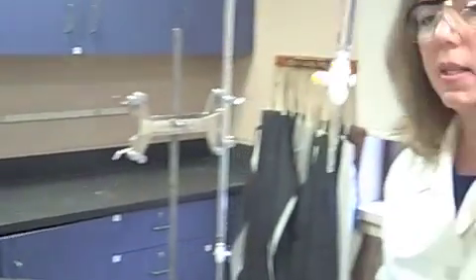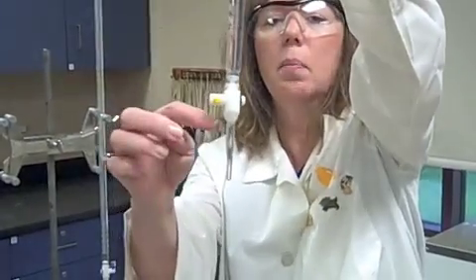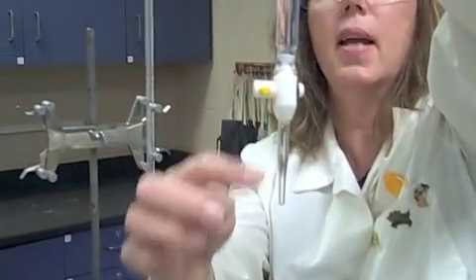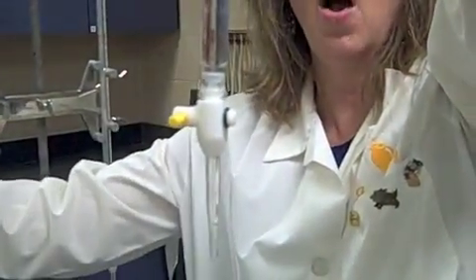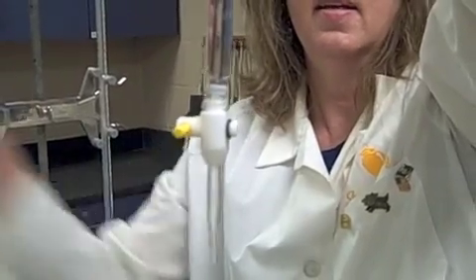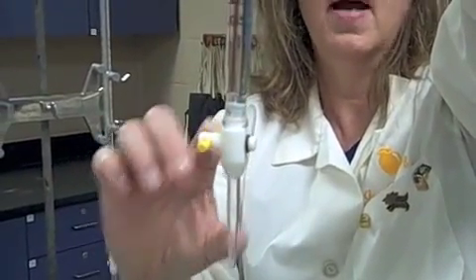Now I want you to notice the tip of the stopcock. The tip is completely filled. If I had an air bubble in there, I would continue to put this parallel until I got all of the acid in there filling that. I cannot have an air bubble. That's going to affect your results.